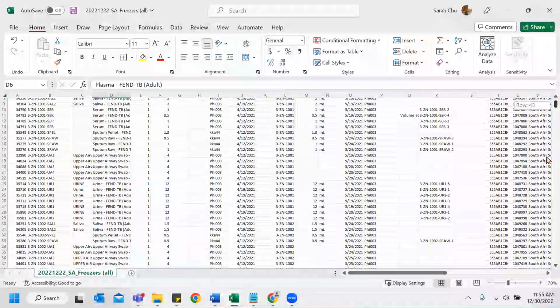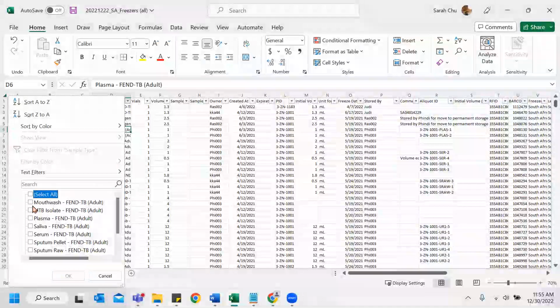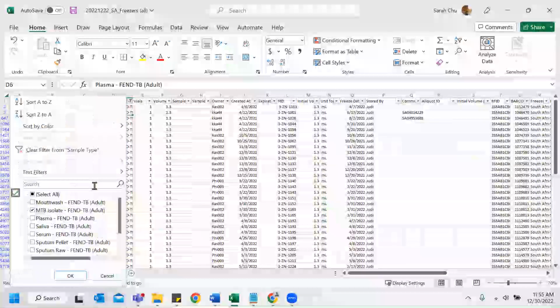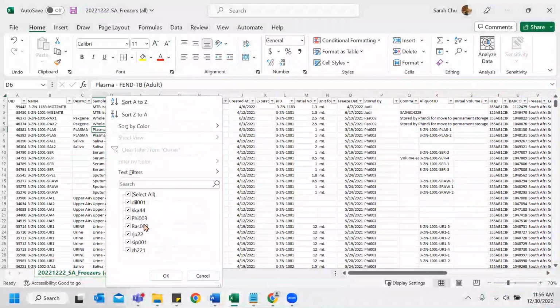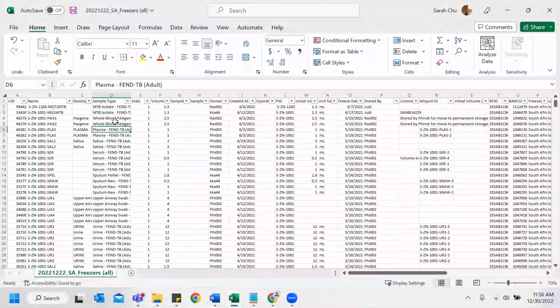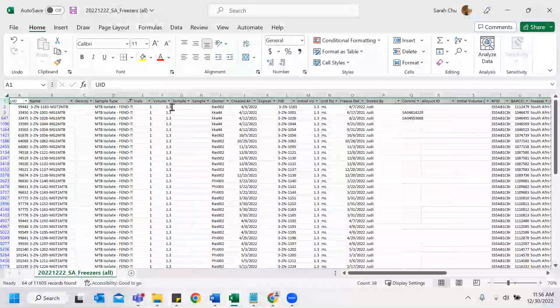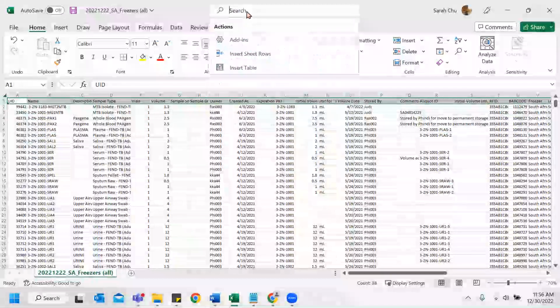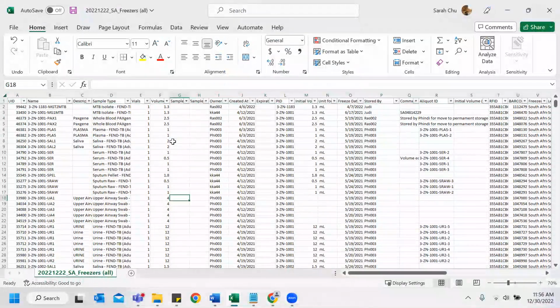So to start off, this is a very big data set, so we're going to examine based on the type of samples. Let's do MTB isolate since I do see an error already. Oh, MTB isolate. So first thing, a procedure is looking for blanks. If your file doesn't have it, you can do a filter, add, remove filters. Okay, filters. And what I usually like to do is I freeze the top pane, so every time I scroll, I can still see the columns, so I know what I'm looking at. So first thing you want to do is look for blanks.